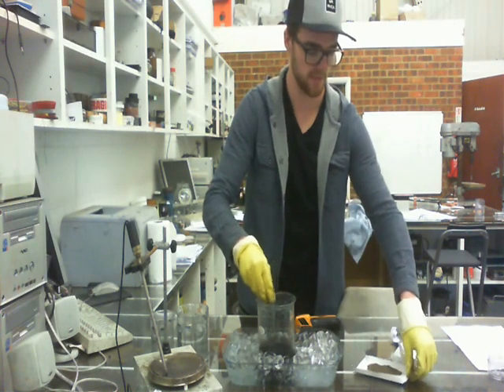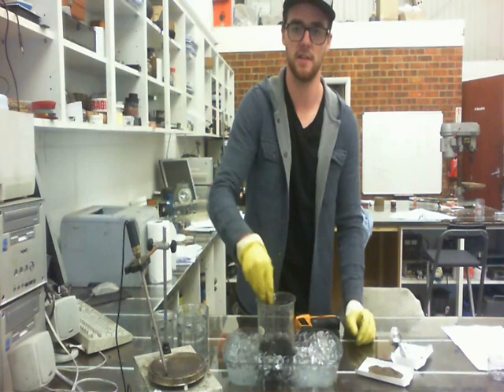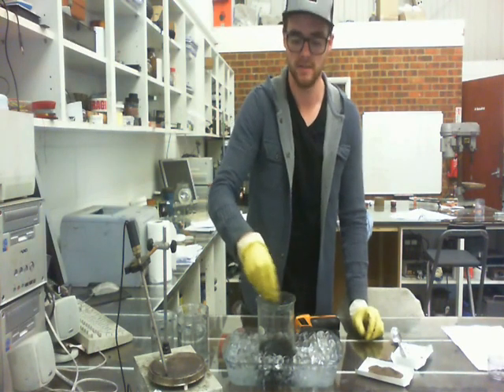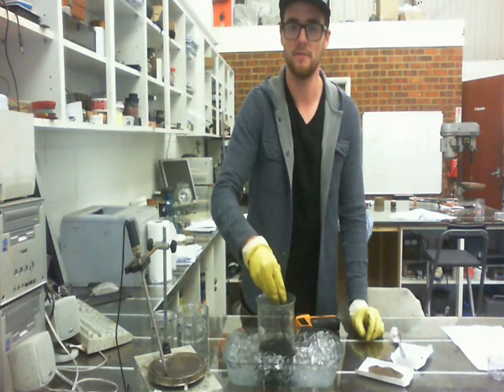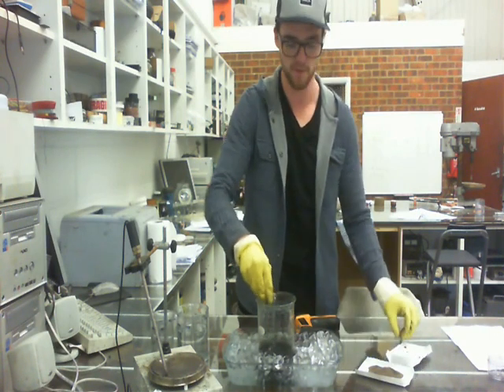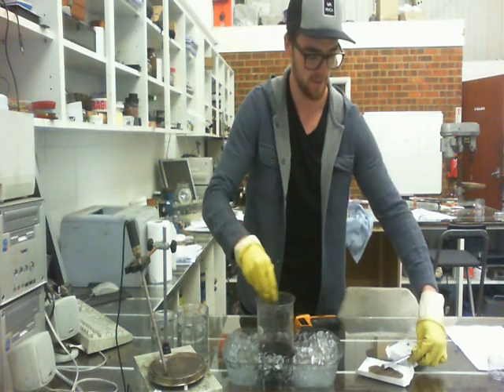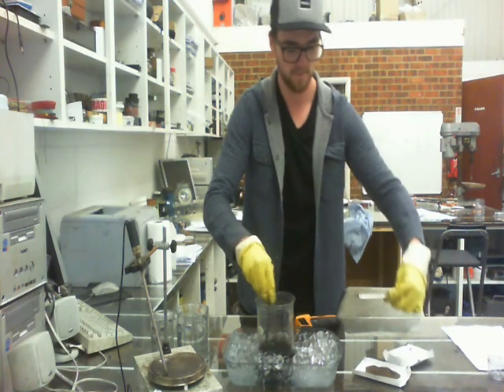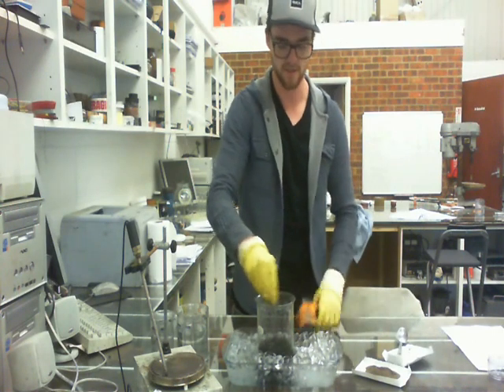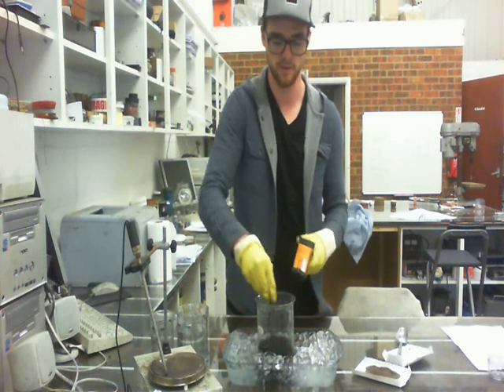I've stirred the graphite and the sodium nitrate down, and now it's time for the potassium permanganate. I've got about 30 grams of it, and we're only going to want to do about a gram at a time, because apparently it will explode if you pour it all at once — I don't know firsthand, but that's what I'm told. So I'm going to put in a little bit here, continually, always stirring. Check the temperature because that's when it really gets important — you don't want to go over 20 degrees.